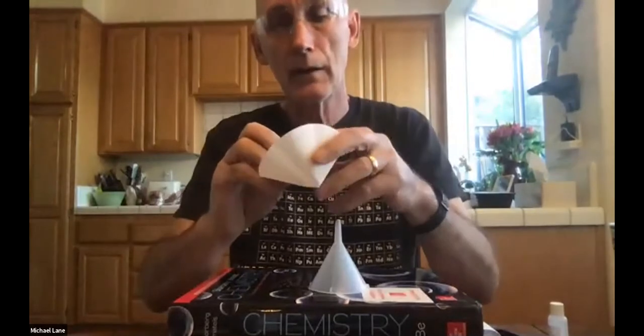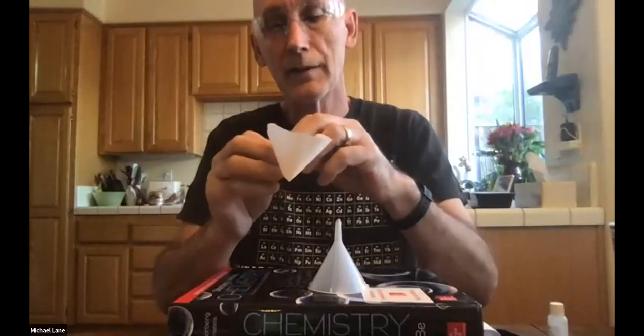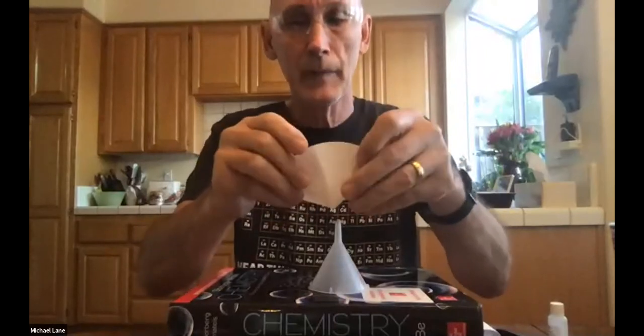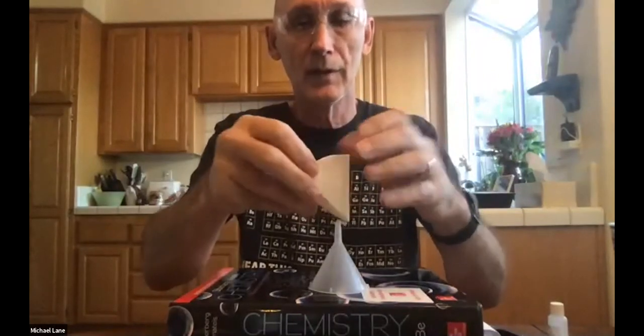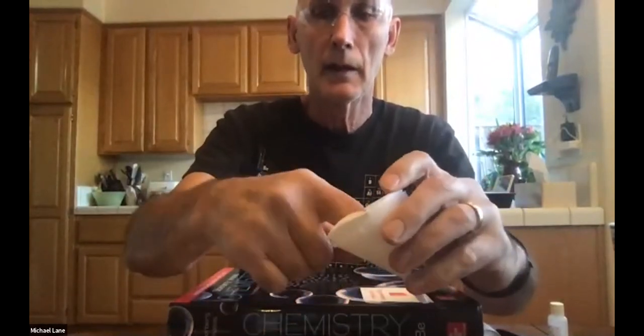This is one of the challenges with these HOL kits: while they certainly provided us the specific stuff that we needed, it is not always the best of sizes. There we go. Again, I don't know if you can tell, but I've just folded it up a little bit more. So do all of this while it's dry, because once you start the experiment to filter things, you're really not going to have the ability to fold it very well. So there we go, I've got that so that it fits in there fairly well. Now let's see if I leave it. Yeah, if you leave it, it's going to come back out again. So I'm going to put that in there.